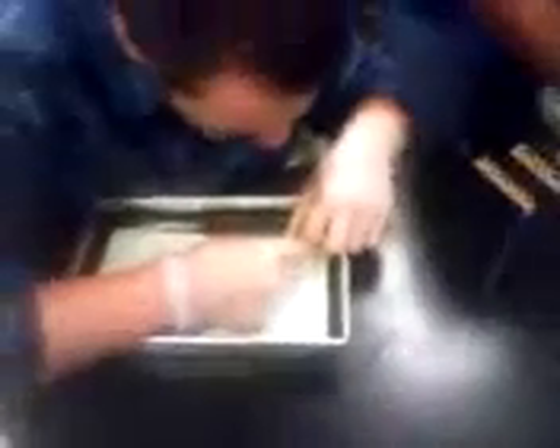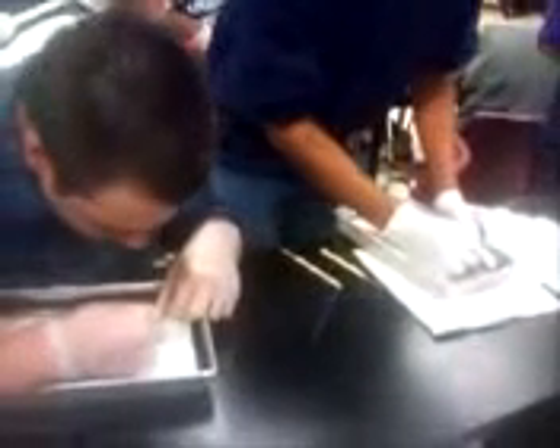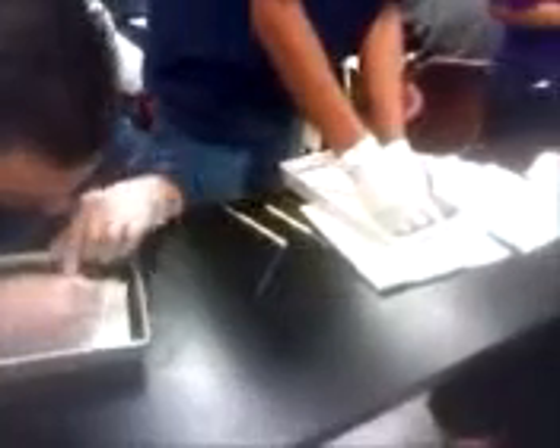It's not even cutting. It's very light. Cut it. You can't get a new worm. You're so nasty. What happened when you put the worm in half on Ashley?